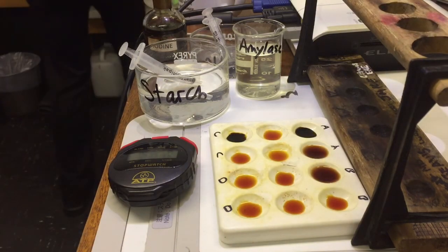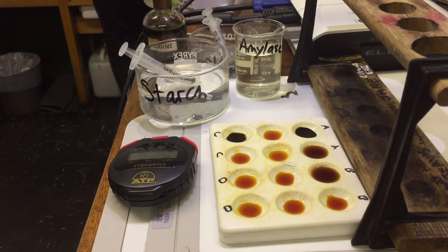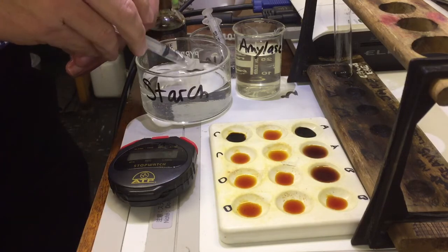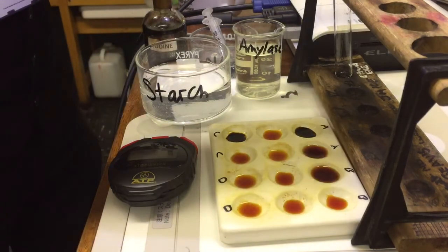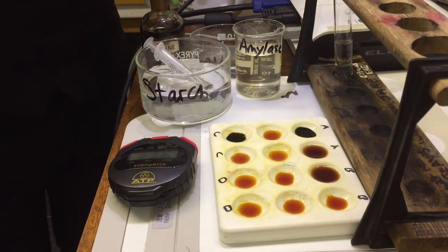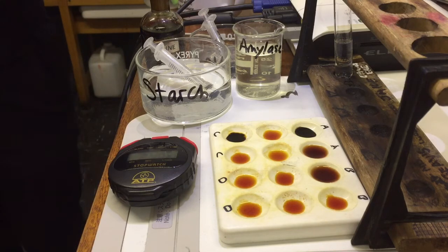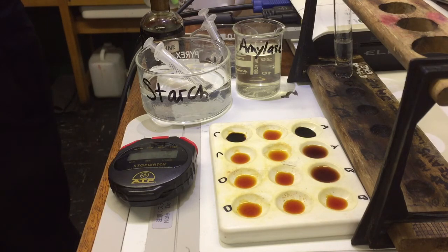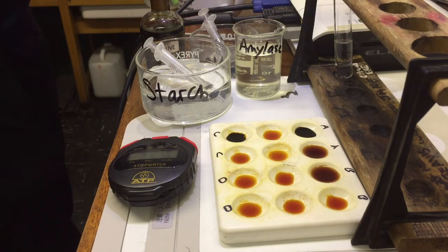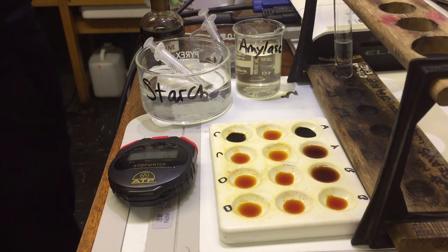I'm going to wash this test tube out to avoid contamination. I take the starch and the pH buffer — this is the one we expect to work the fastest because it's at pH 7. Amylase in the mouth — what pH would that be? 7. So we expect this one to be the fastest. The other ones we'd expect to slow down because the enzyme will denature — which means it'll change the shape of the active site so the substrate won't fit.